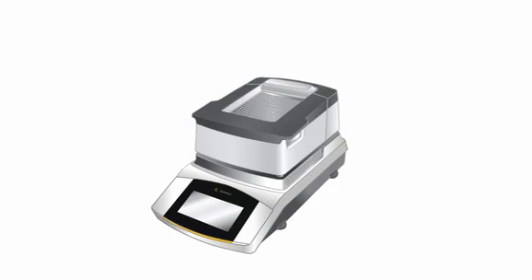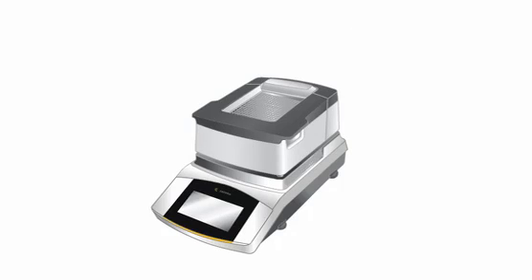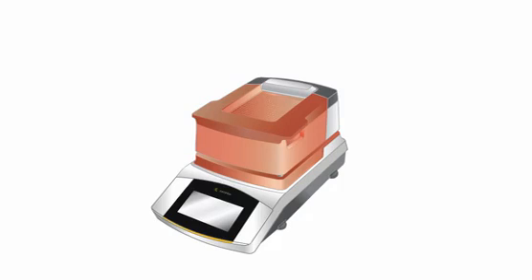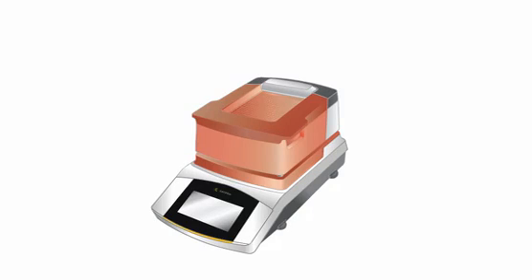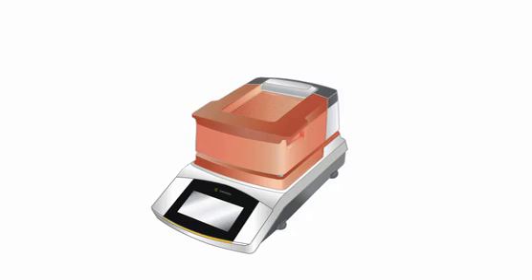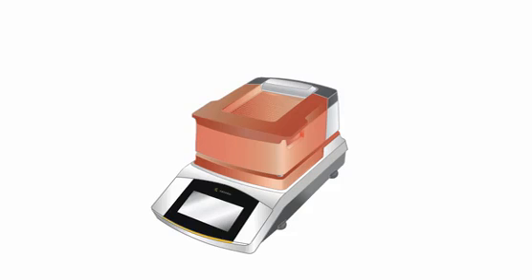Cleaning the moisture analyzer MA-37. The hood of the MA-37 is dishwasher safe, as well as the sample chamber plate. Remove them from the device, and together with the sample tong, they can be easily cleaned in a dishwasher.